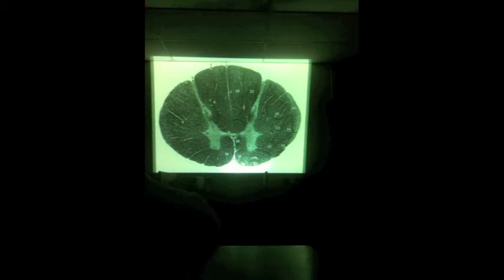And for the EMs that we have out, if you look at a Schwann cell, how do you know it's a Schwann cell versus an oligodendrocyte? If you're just looking at the cells themselves and you don't know where in the nervous system you are, what's usually your big indicator?